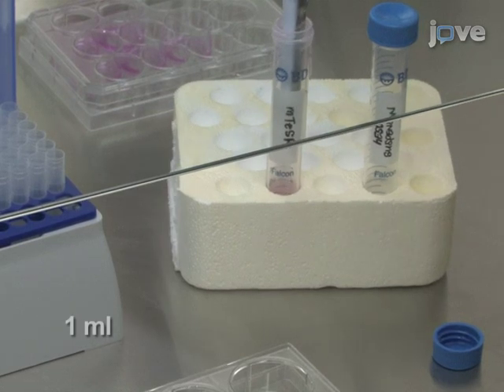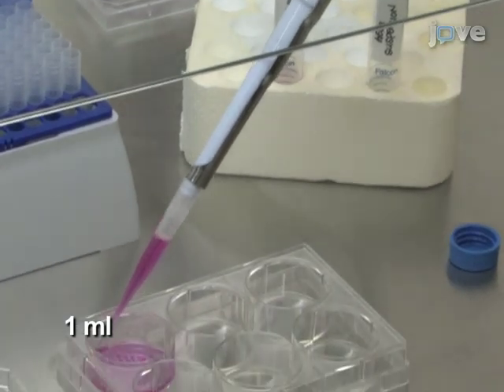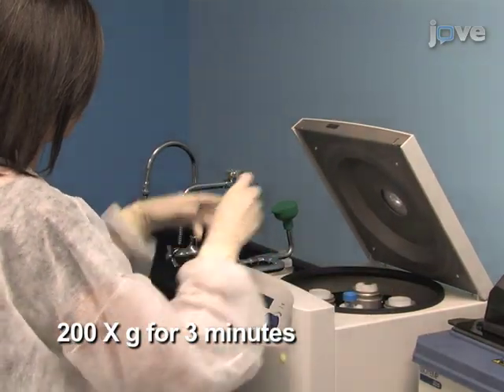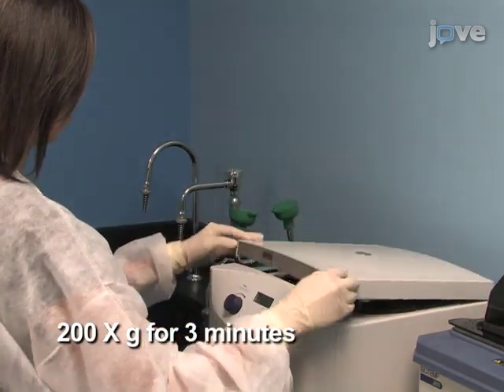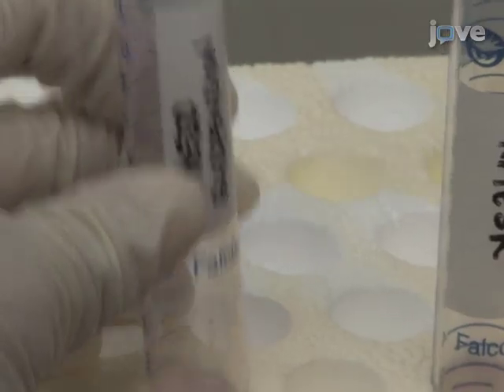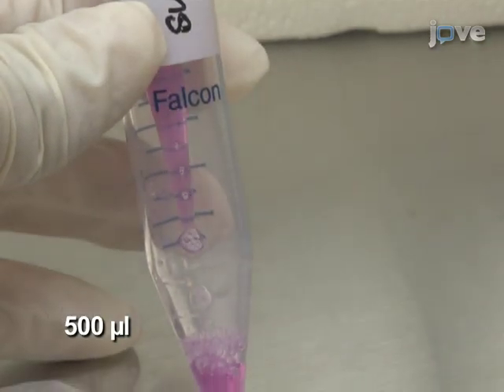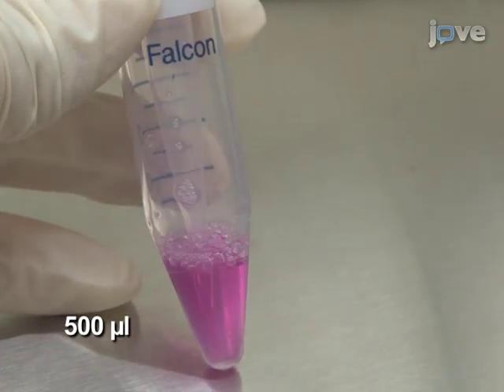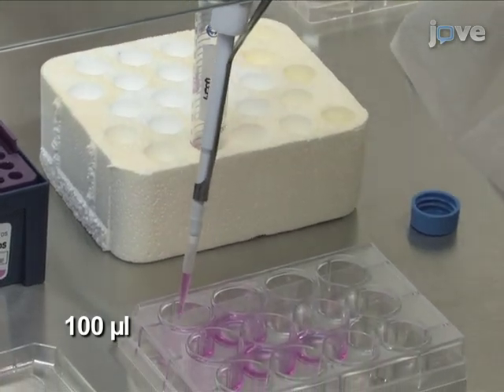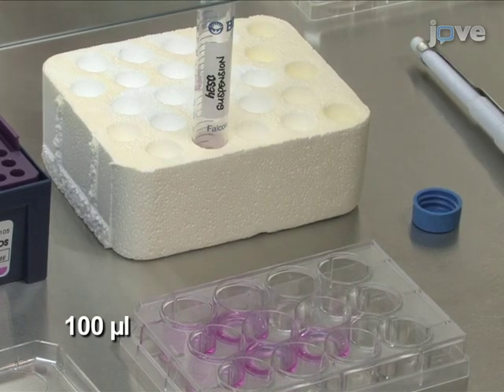Neutralize Accutase using 1 ml of human embryonic stem cell maintenance medium or mouse embryonic fibroblast conditioned medium. Collect detached cells without the beads into a 15 ml conical tube and centrifuge at 200 G for 3 minutes. Decant the supernatant and break the pellet with 500 microliters of fresh human embryonic stem cell maintenance medium, or mTeSR. Plate 100 microliters of the HESC suspension dropwise into multiple wells of a 12-well Matrigel-coated plate.